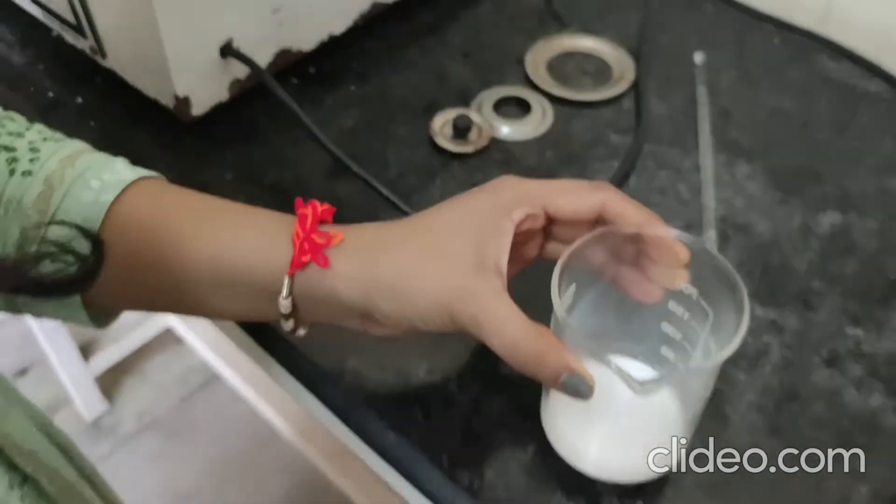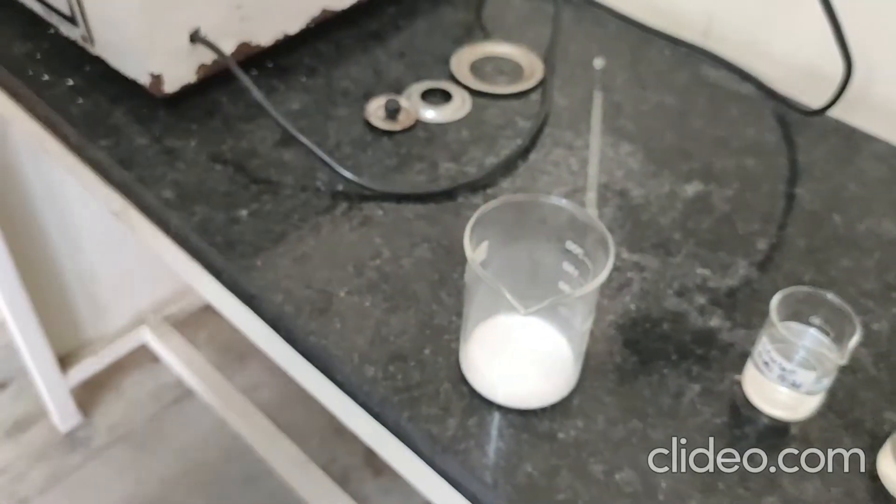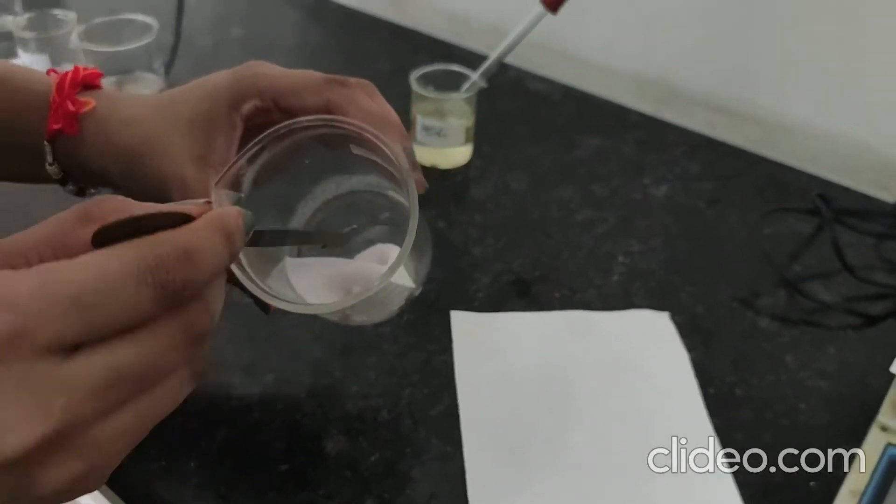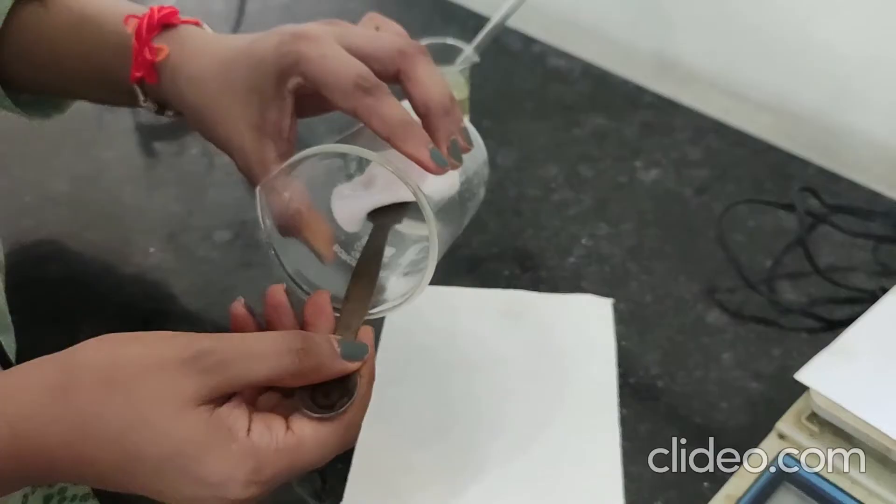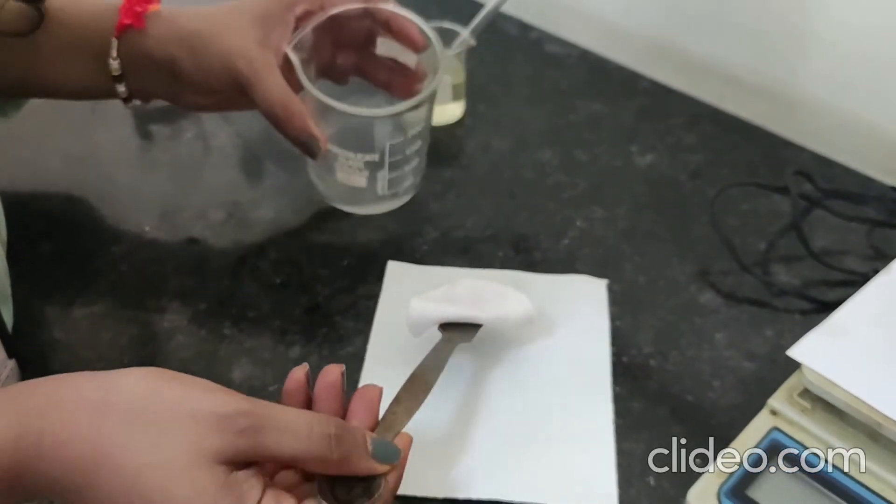Now you have to filter it by using filter paper.